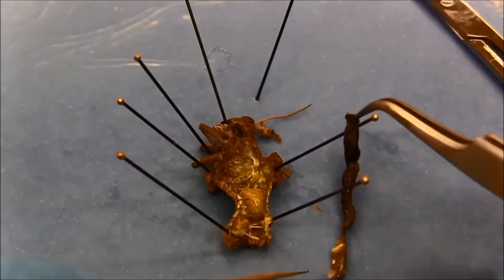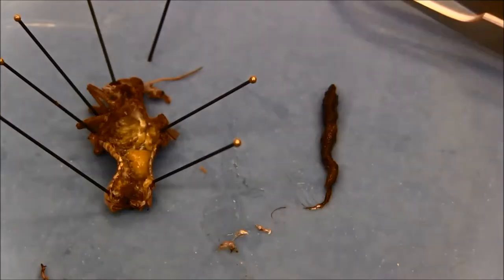Now the gut is isolated and I can immediately proceed with DNA extraction, or I can store the gut in ethanol in the fridge and do DNA extraction later.